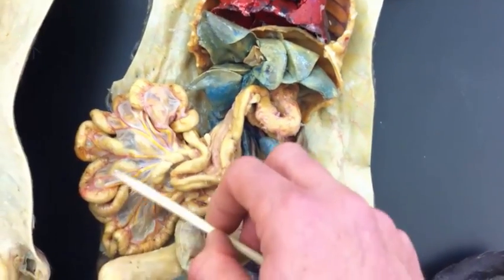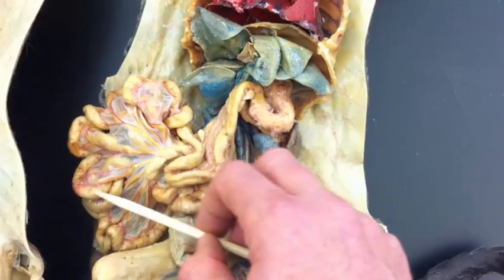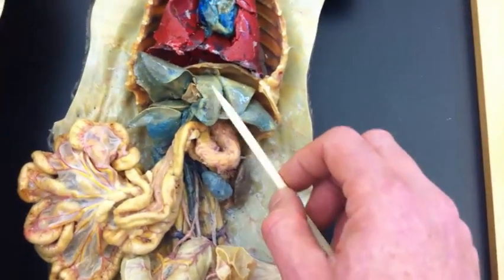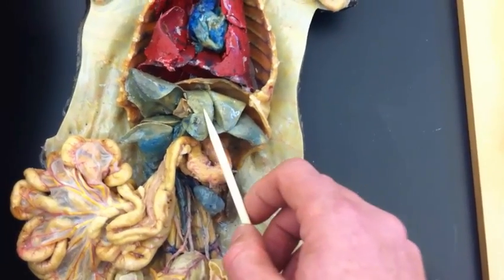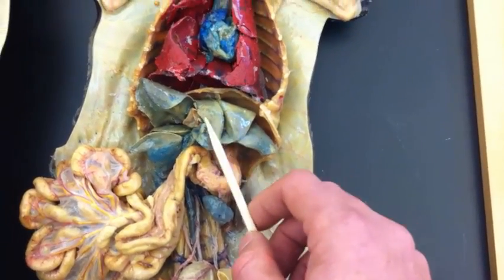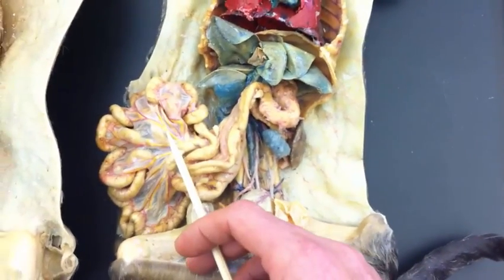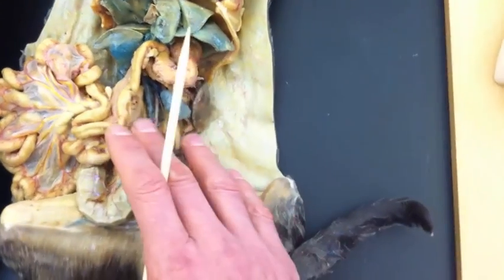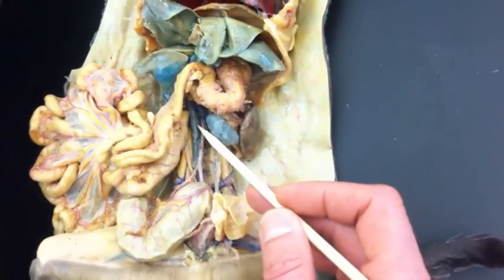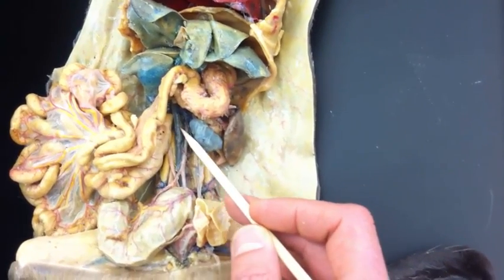The importance of it is when you absorb nutrients by the gut, and sometimes you absorb toxins from your gut, those nutrients and toxins go to the liver first for possible storage or detoxification before they get out into general circulation. So that's some physiology about the hepatic portal system, why we have it. Back down here in the abdomen, this is inferior vena cava, big blue vessel coming down here.